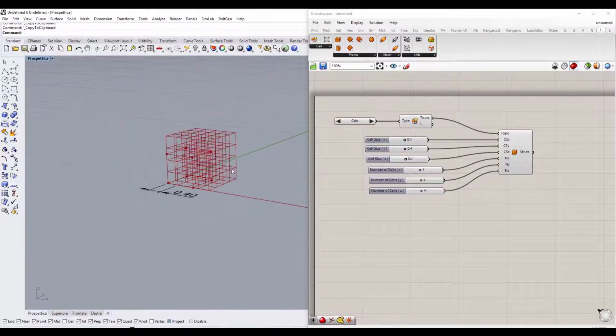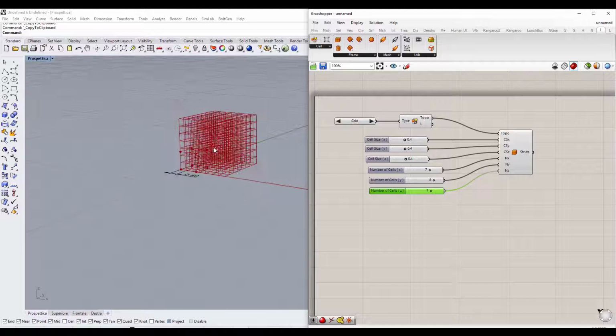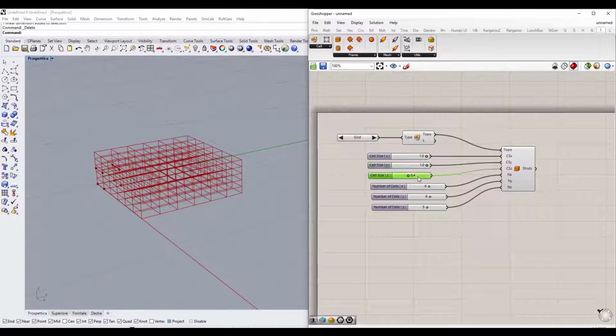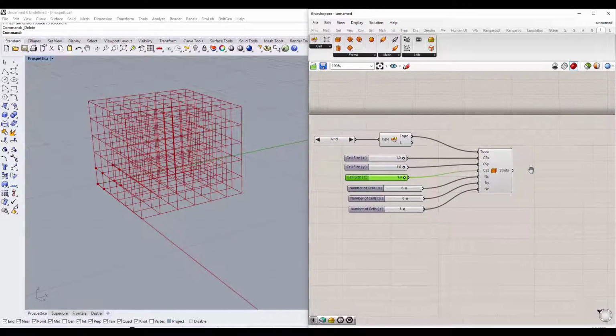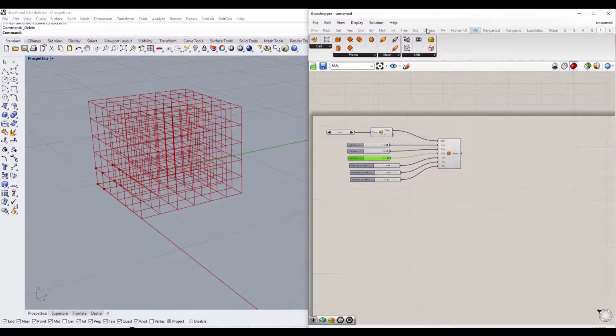The advantage of this parametric process is that at any time we can modify our scaffold simply by moving this slider this way. To make our scaffold compatible with normal 3D printers, we should increase the cell size to at least 1 mm. Now let's assign a thickness to all the wireframe rods that make up our scaffold.